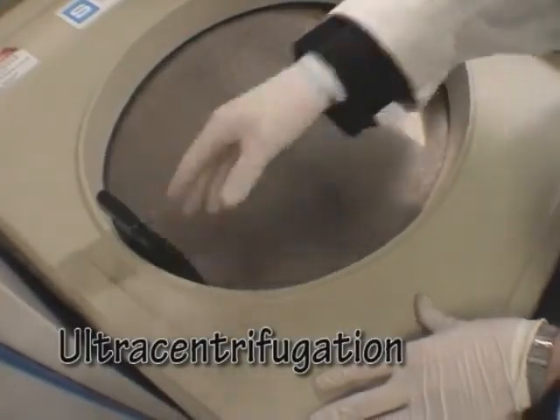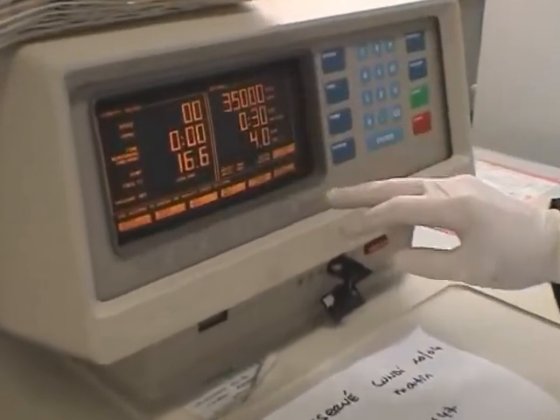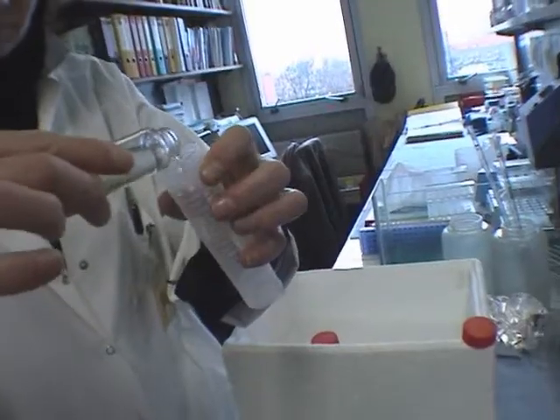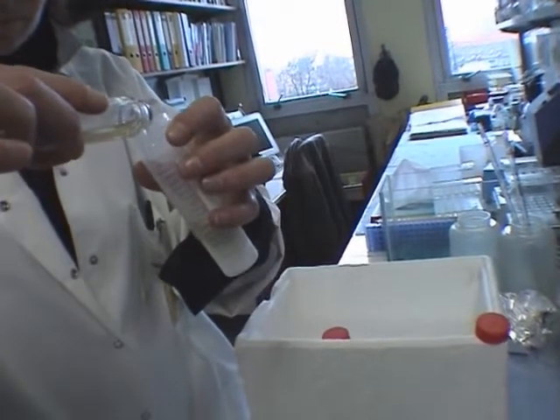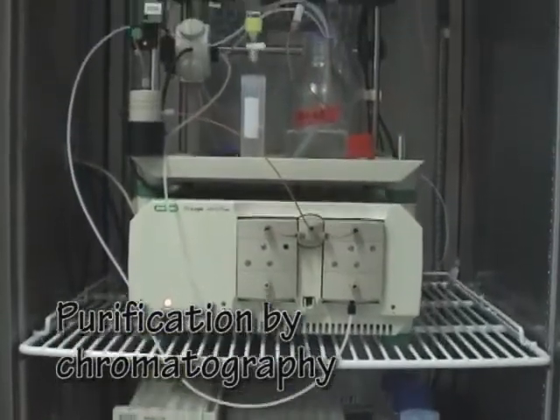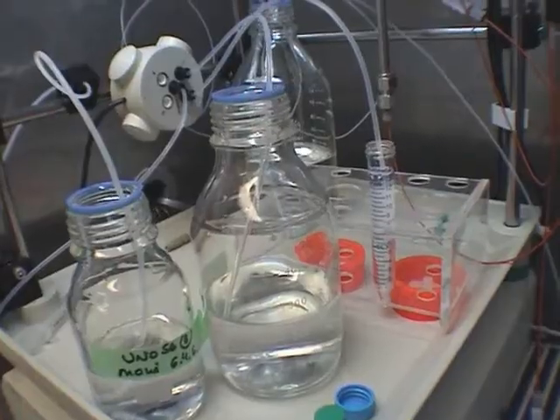Centrifugation at high speed pellets the cellular debris, and the liquid or supernatant containing the molecular contents of the cells is recovered for treatment by chromatography. By injecting the supernatant into a chromatography column, the molecules can be sorted as a function of their properties such as size or electric charge.